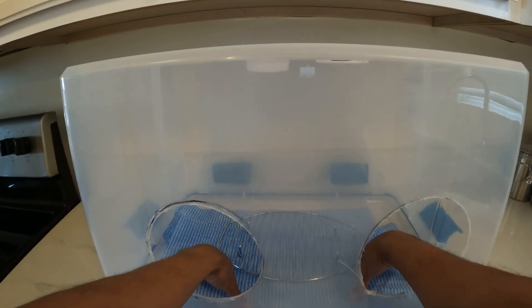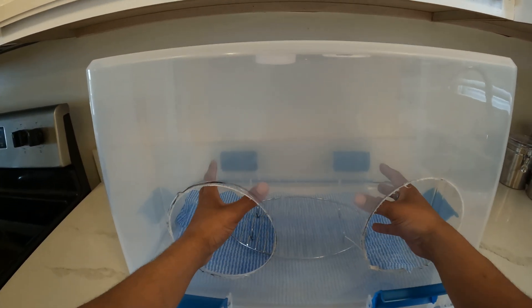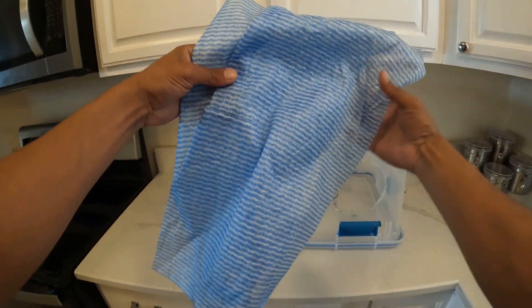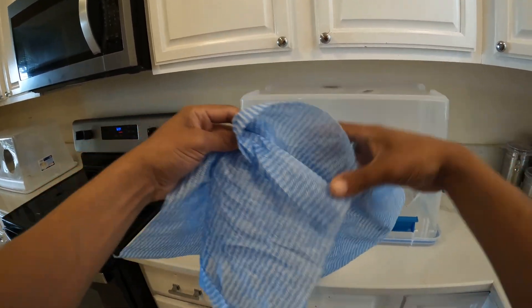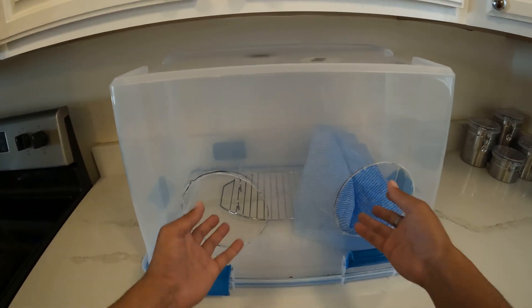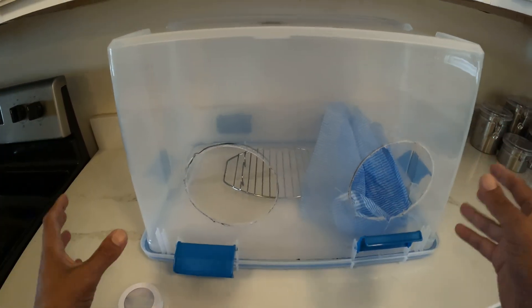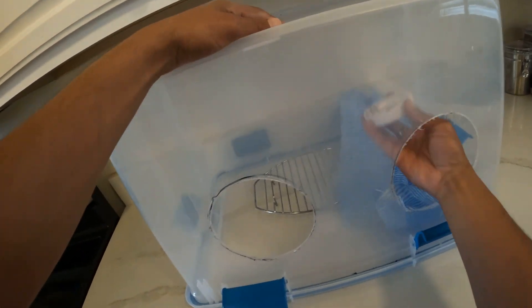This is a little bit upgraded. This is just a cooking grate right here — what this allows is you to not be working on the bottom. People will put a towel down, but you want to make sure it's a really thin towel, otherwise when you're pouring your agar it's going to be lopsided. What I like are these little wipes you can get at the grocery store — they're reusable, you can wash them a few times, they're really thin-layered, and that will allow that if there's any dust or anything in here, it won't be spread as easily through the air.